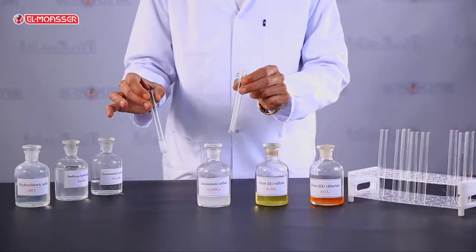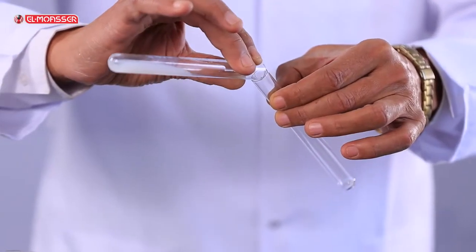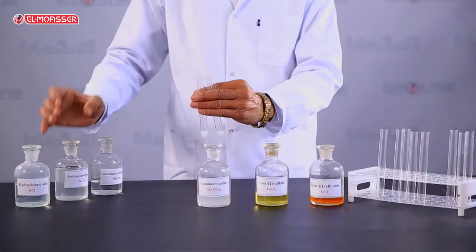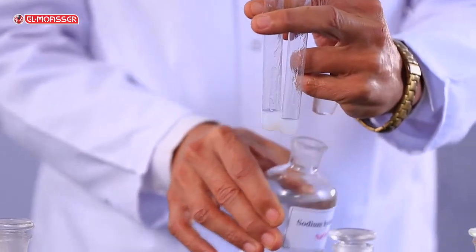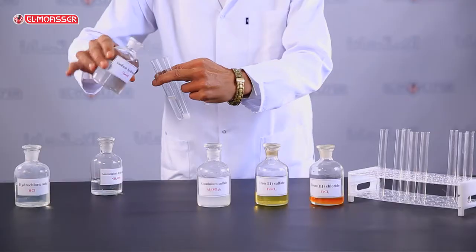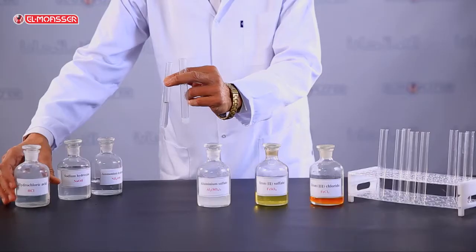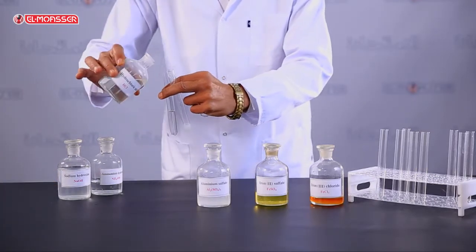The formed precipitate is divided into two test tubes. Add sodium hydroxide solution, known as caustic soda, to the first test tube. The aluminum hydroxide precipitate is soluble in caustic soda solution.